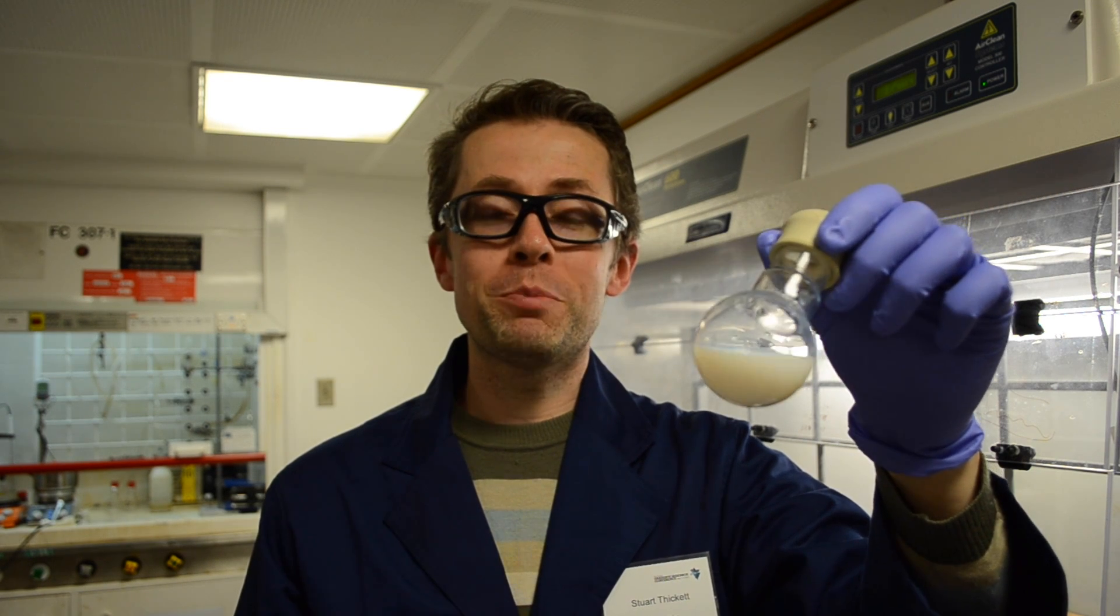And so that's it. We've made our emulsion polymerization. We've got our nanoparticles dispersed in water here in our round-bottom flask. And so that brings us to the end of our video. Thanks very much for your attention, and I hope you've learned something about the polymerization industry and the way in which we make these important materials.